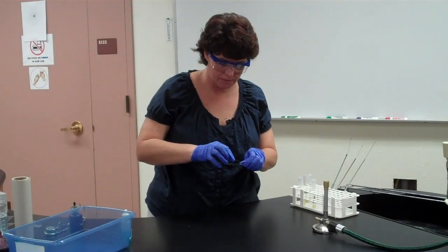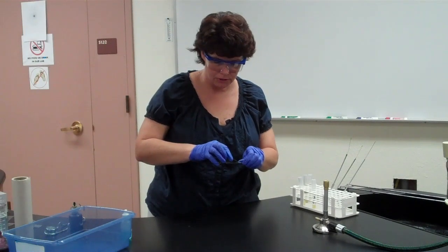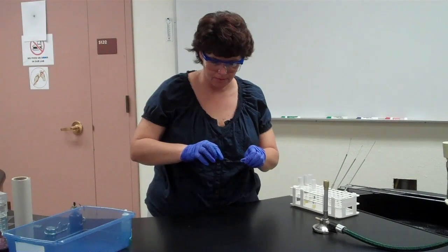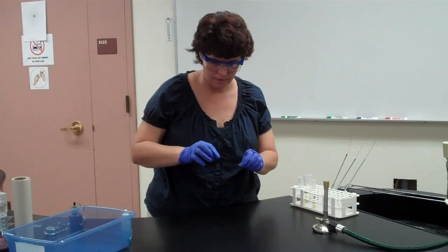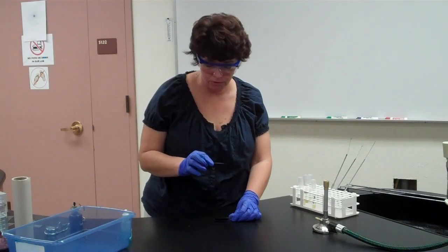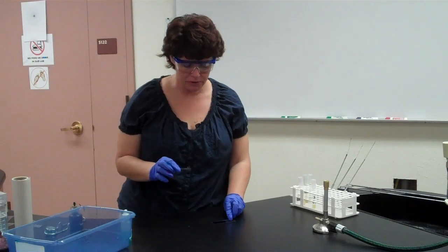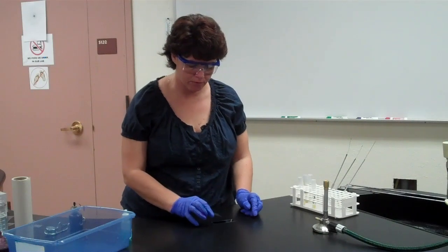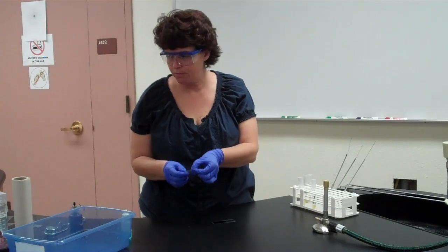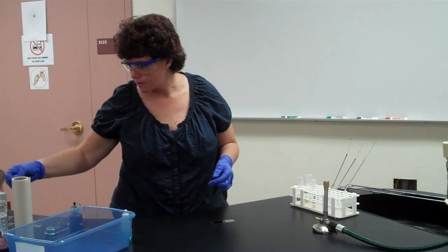We want to take this bacteria mixed with crystal violet and spread it. You're going to take a clean slide and gently drag it across the top of the smear to spread it. I have way too much crystal violet on there — when you do it, use just one drop. Also, I'd suggest starting from the edge of the slide so you have more room to drag. This slide now has bacteria on it so it goes into the waste beaker.